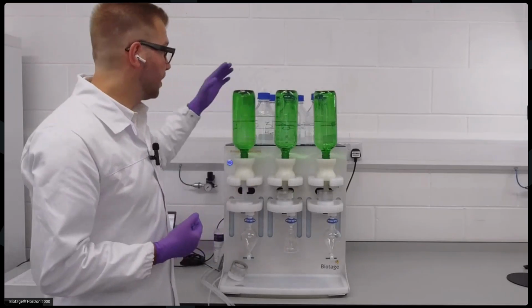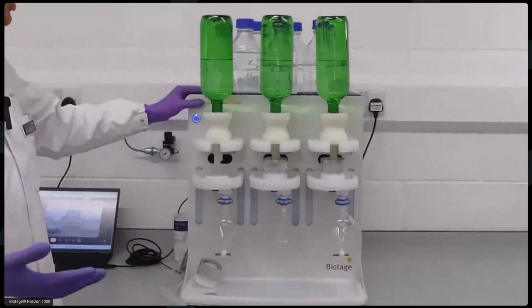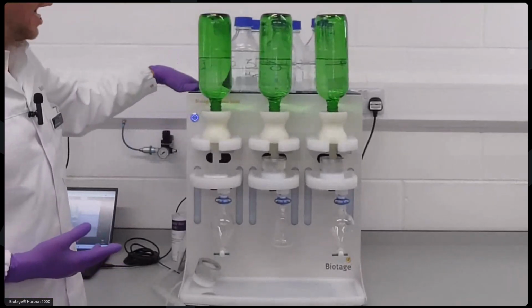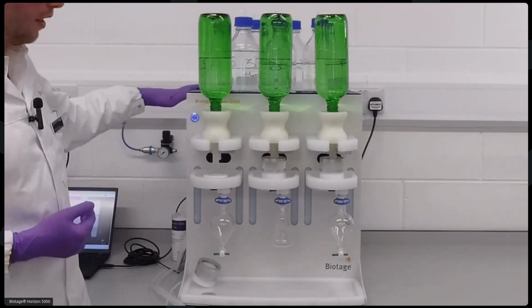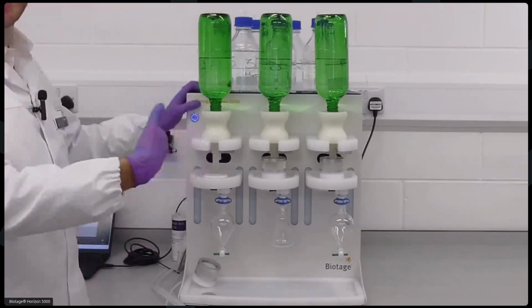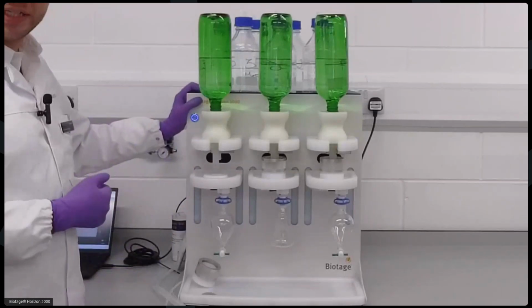So atop here, you'll have something that's very familiar to most people that have used HPLC, which is just your solvent storage at the top. And this system accommodates 7 different solvents. Then each station has its own waste lines, which are separated into organic and aqueous waste.